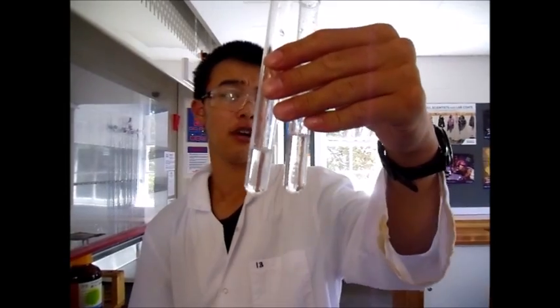Hello. Today I have two organic solvents. They are both clear and colorless solutions with a strong odor. I know one of them is cyclohexane and one of them is cyclohexene.